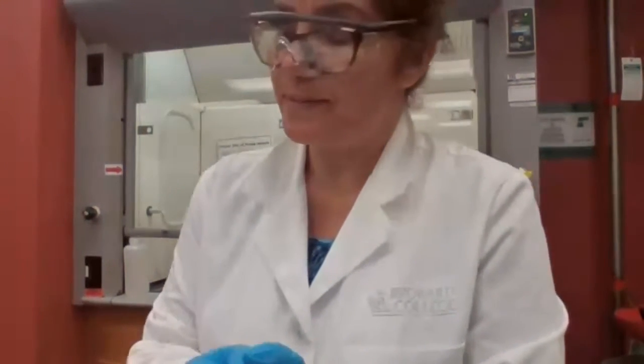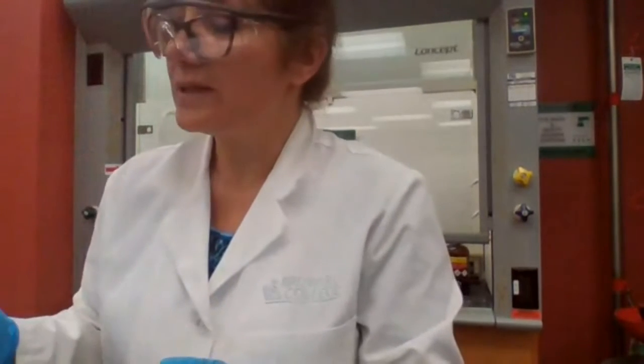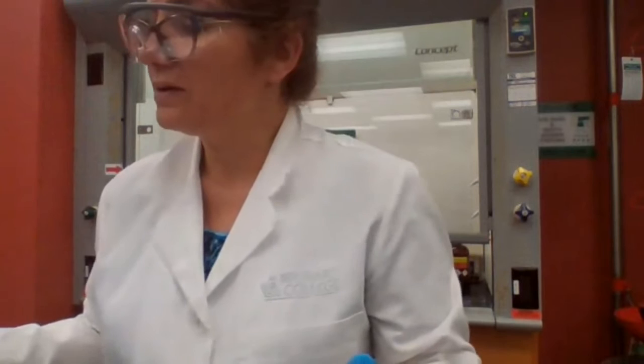Okay, let me go ask for phenol, and then we can do some of these experiments with the phenol. What time do we have? 1:38. Okay. Let me see if they need phenol. I said no. We do only hydrocarbons and alcohols.